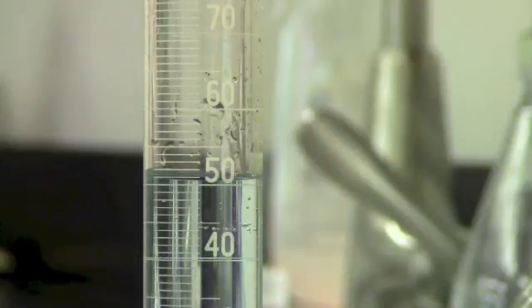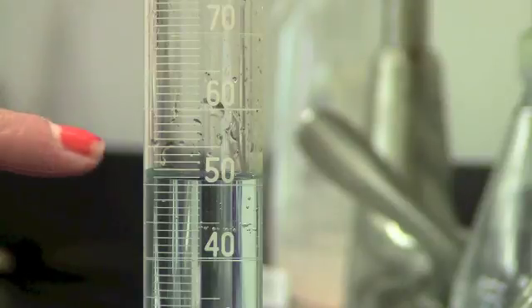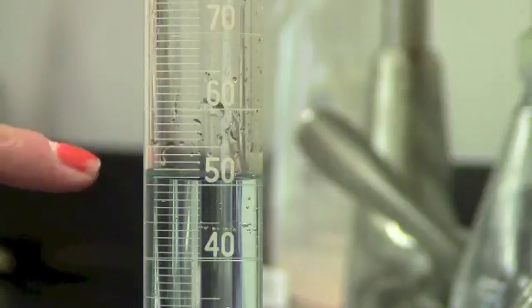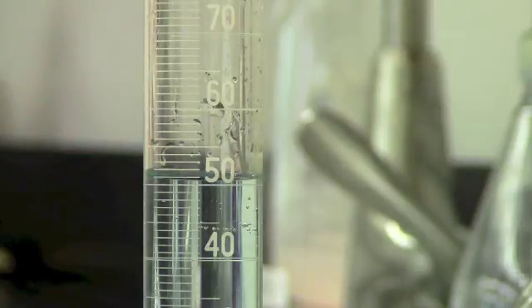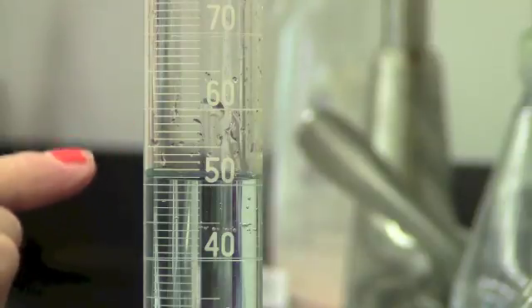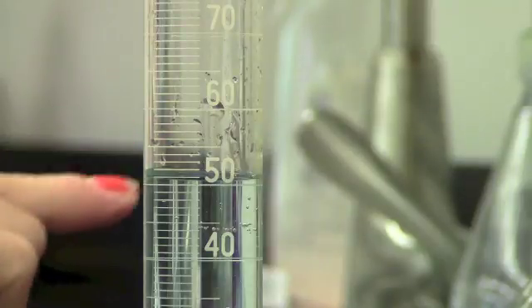Now I want to measure the precise volume of the liquid in the graduated cylinder. So I'm going to want to get on eye level with the liquid in the cylinder. You might have to duck down to do that. When you do this, you'll notice that the water level actually dips a bit. This is called the meniscus. So you want to take a reading from the bottom of the meniscus, the bottom of the curved part of the liquid.